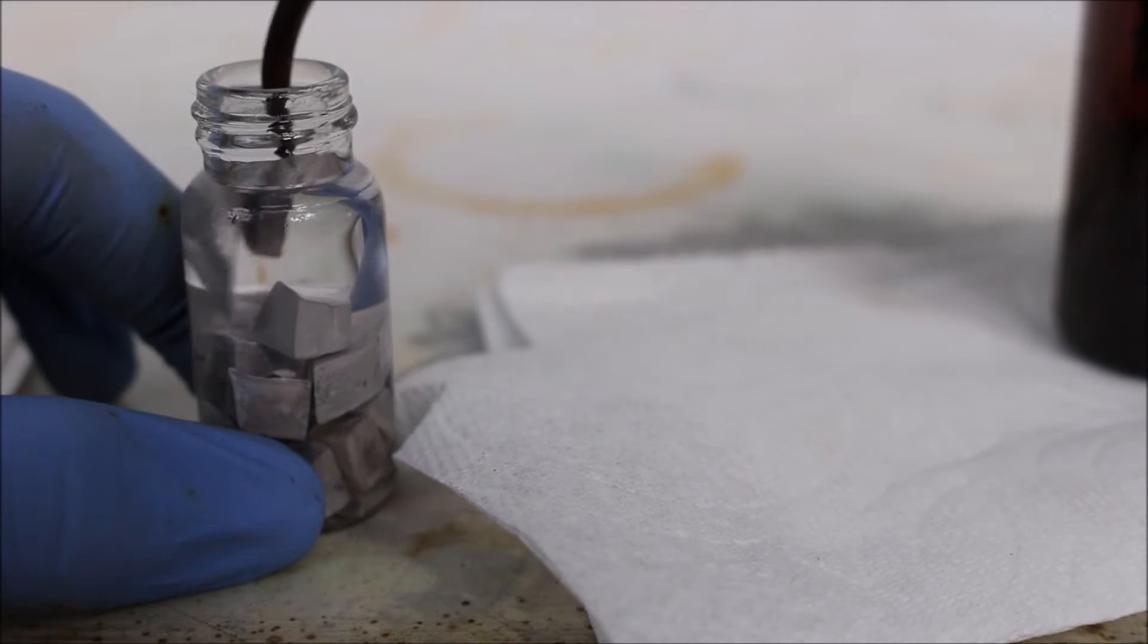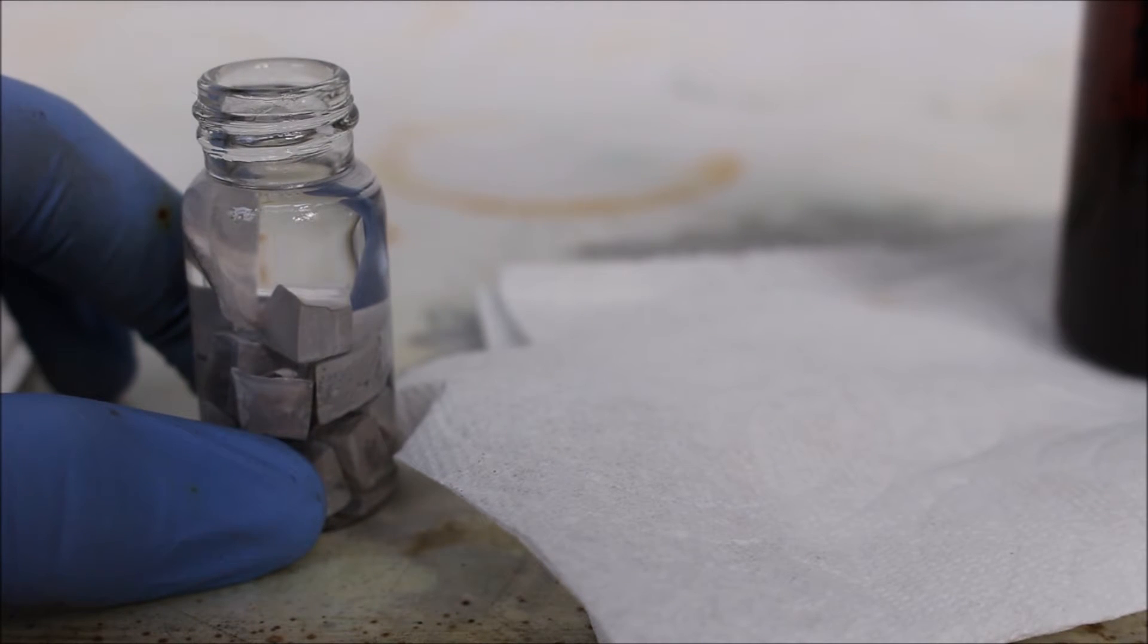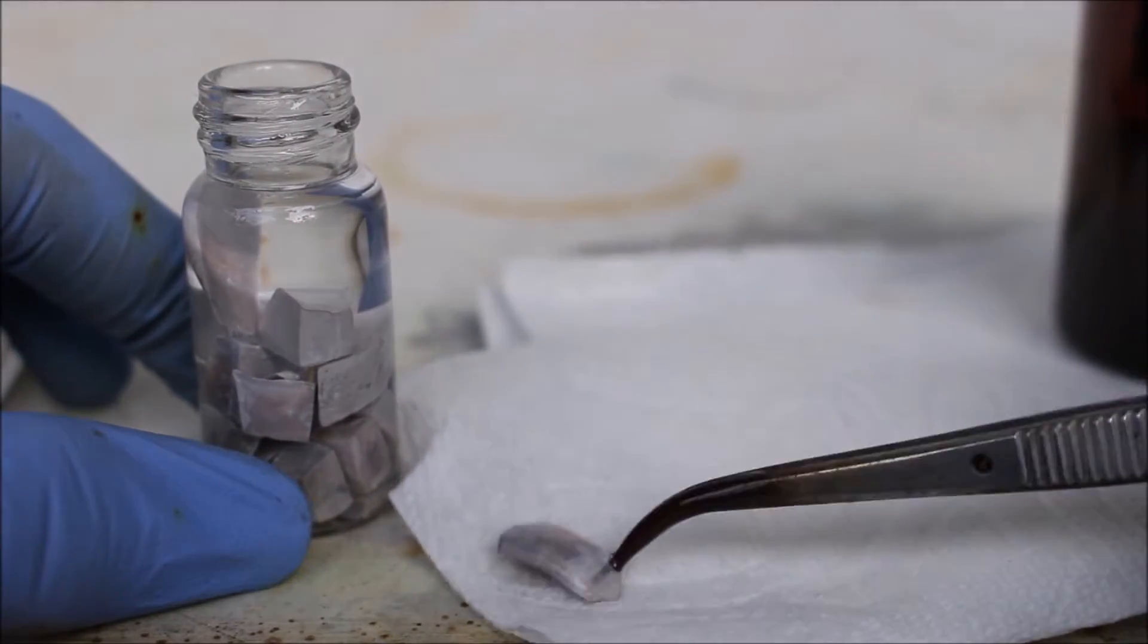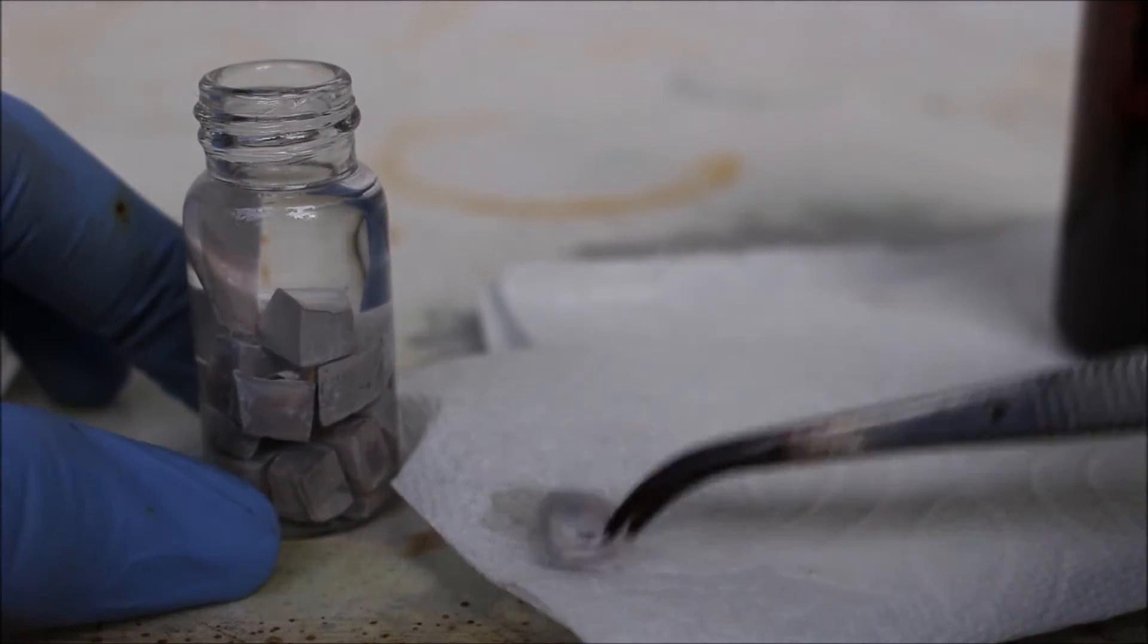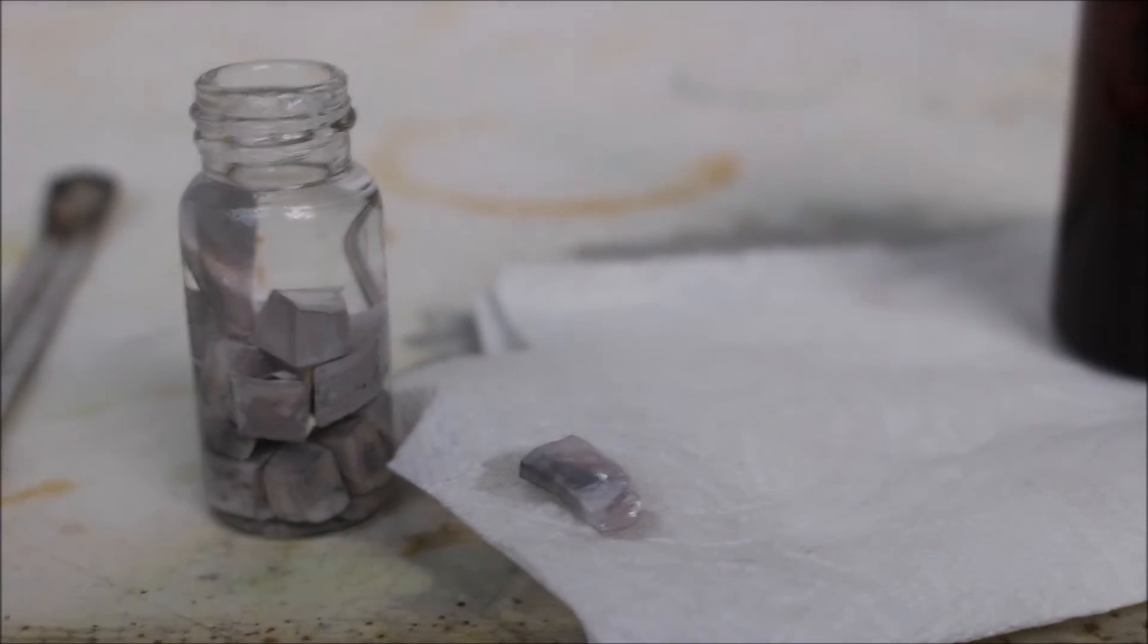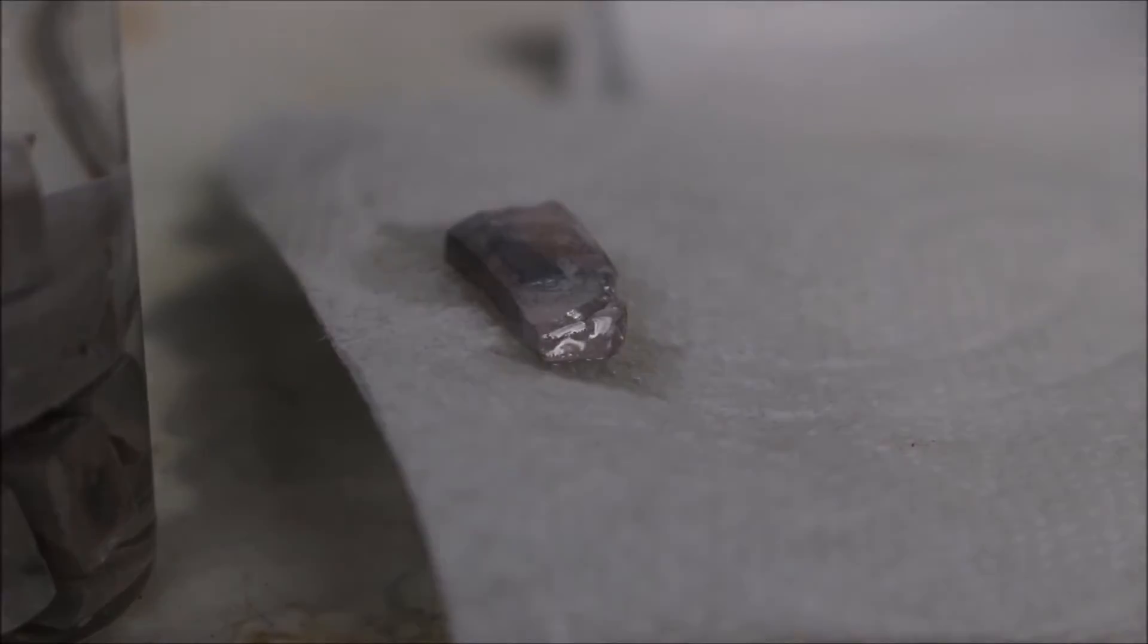So, let's get a piece. Oh, here's a nice one. Very nice piece of sodium. Now we're going to dry it off on this paper towel, because it has oil and we want it to have a nice surface to react with the iodine.